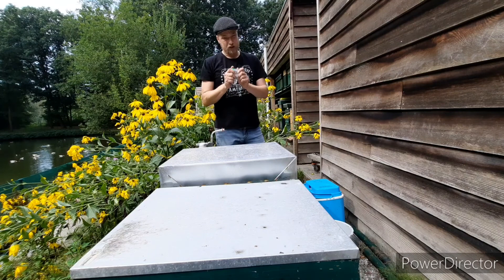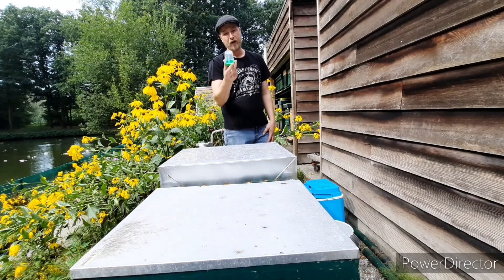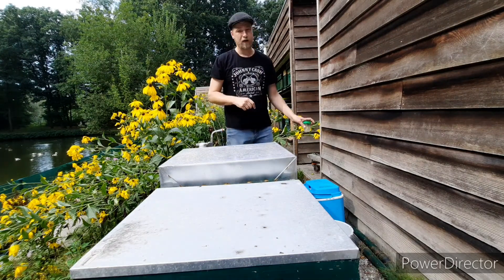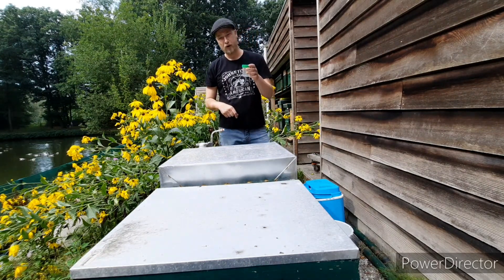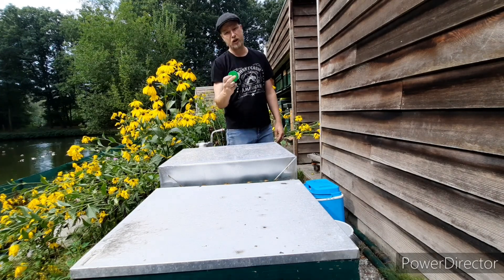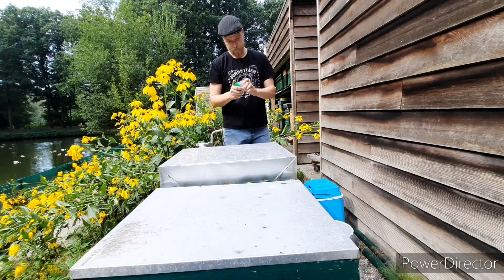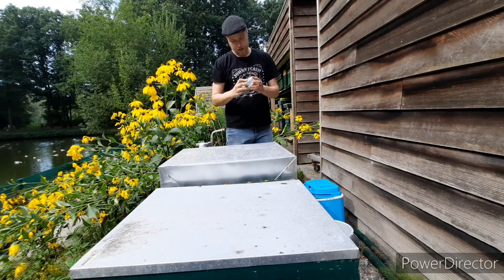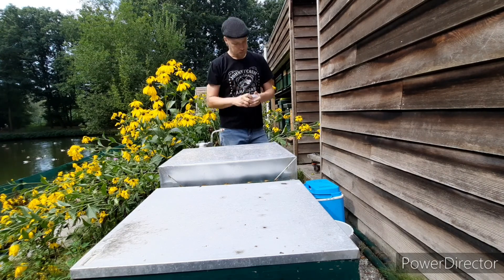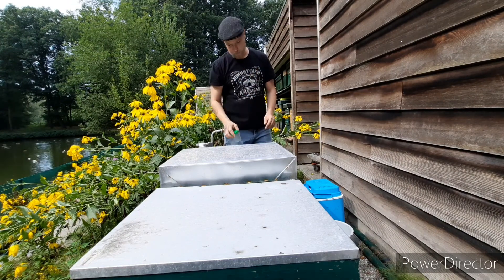The cool box is because these are cold-blooded. If I put bees in here and I put the lid on and leave them, they will die a horrible death. But if I close the lid and put it in a cold cool box or immediately in the freezer, they're cold-blooded so they fall into a slumbering sleep and die without even knowing it — they go into a sort of coma because of the cold. That's the most and only humane way to take a sample from the bees.